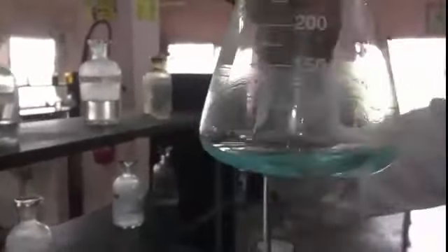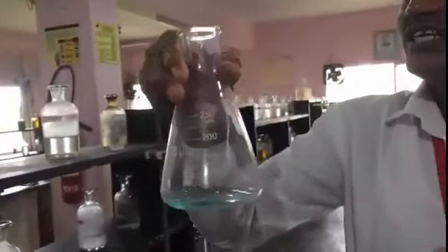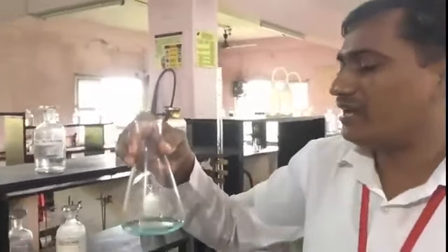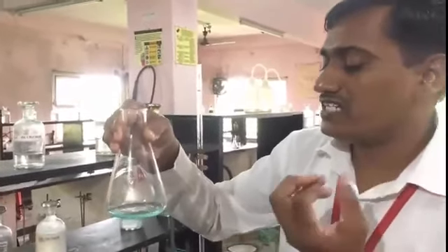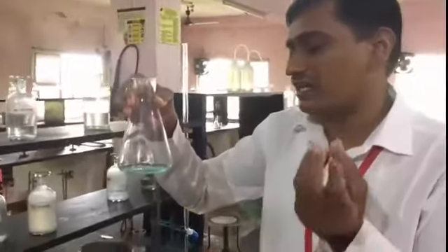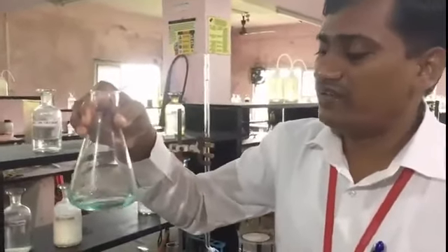Now you are thinking, why do we first convert into a precipitate and then again convert it into a clear solution? The reason behind it is that the copper is in salt form, that is copper sulfate pentahydrate. First of all we have to make it free from that copper sulfate by adding a base, sodium carbonate, and it converts into copper hydroxide. Now this copper hydroxide, an alkaline solution, once again we neutralize with the help of acetic acid. Now these copper ions are free, dear students.